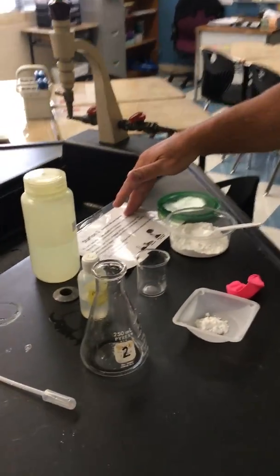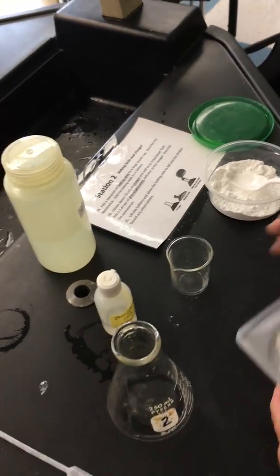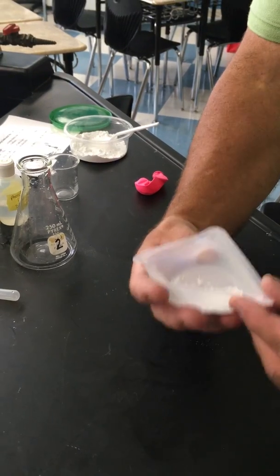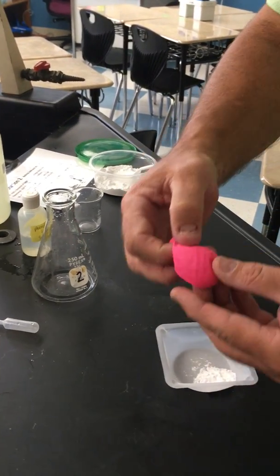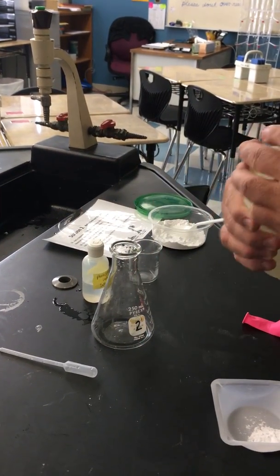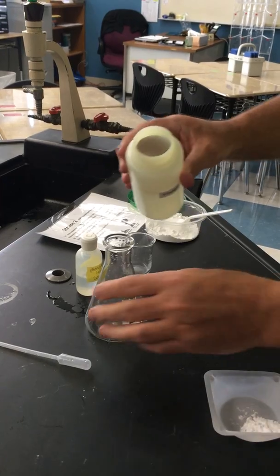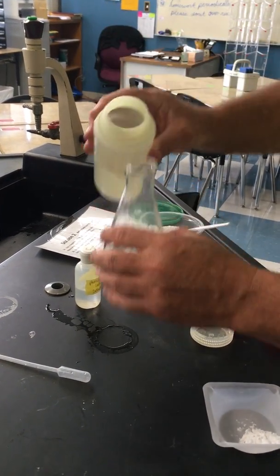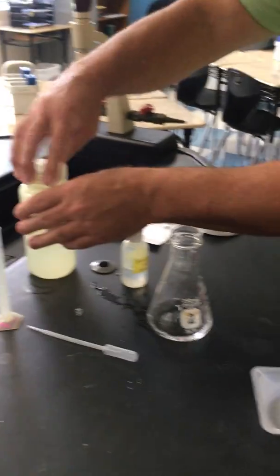In station 2, we're going to mix baking soda and vinegar in a controlled environment. In this little container is baking soda, so you should write down what it looks like. It's a white powder. I have already transferred the baking soda to a balloon, so it's in there already. This is vinegar, which is a clear liquid. You should know what that smells like. It says get about 10. We're going to really estimate. Get about 10 in there. Put the cap back on for safety.